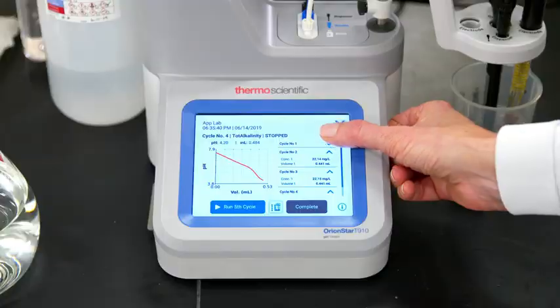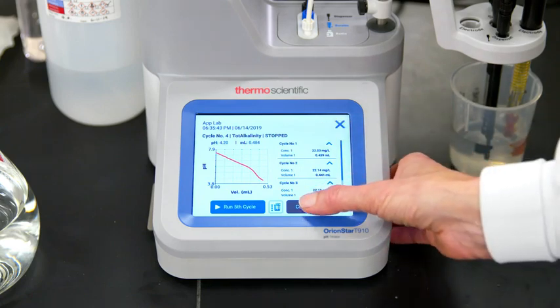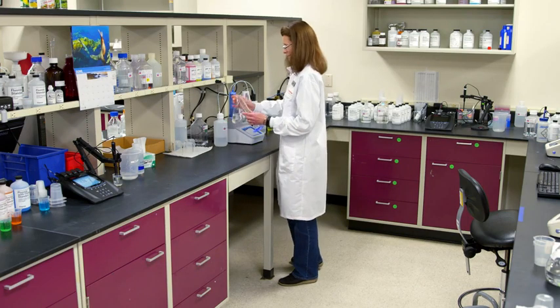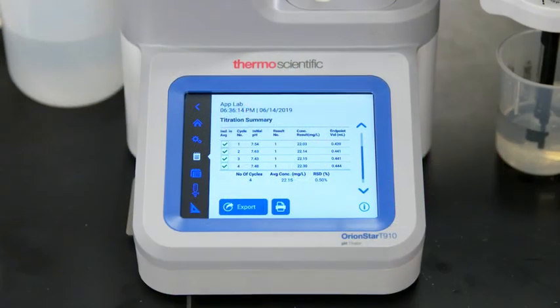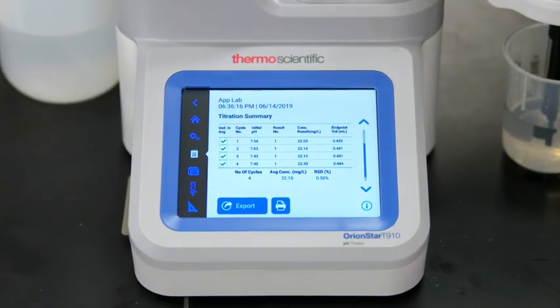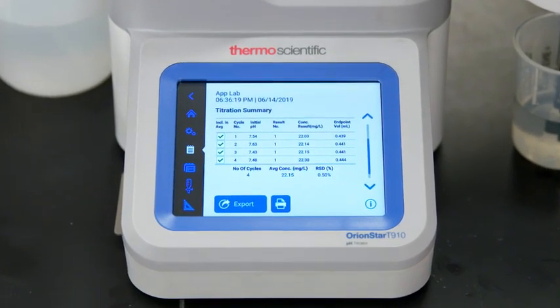Let's take a look at the result. If I want to, I can run another cycle, up to five cycles per sample. The titrator takes the cycle results and provides an average concentration and an RSD value for me.